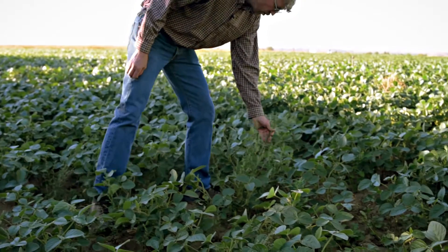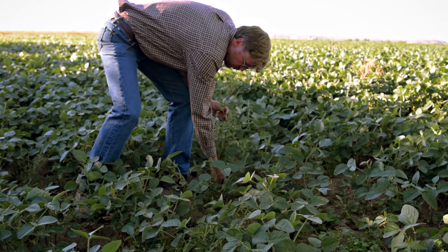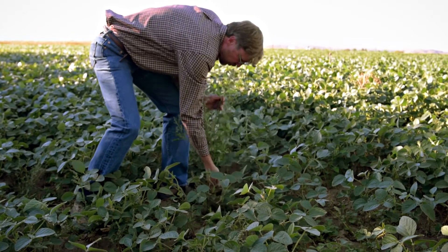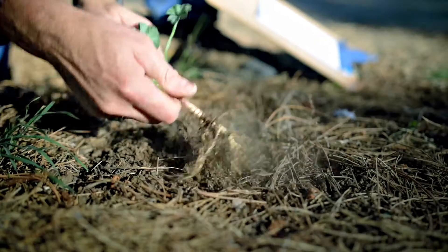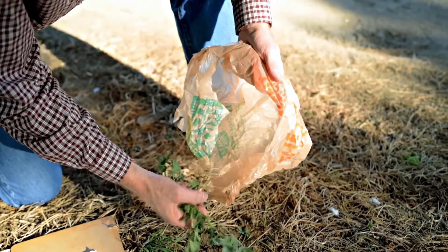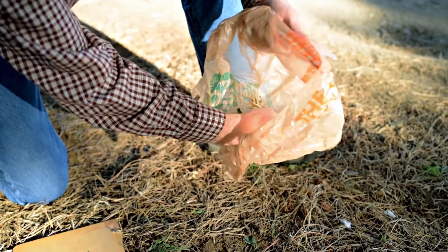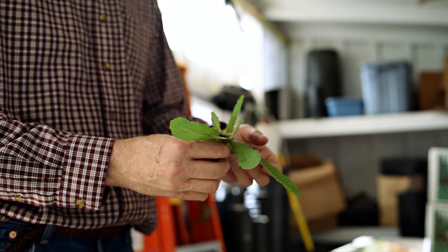When you go out and collect a plant to be identified, it would be best if the sample comes back with its roots, leaves, seeds, and flowers if at all possible. If you have a weed species or plant you need to identify, make sure that plant is fresh — collect it, keep it in a plastic bag or put it in the refrigerator so it doesn't desiccate or mold.